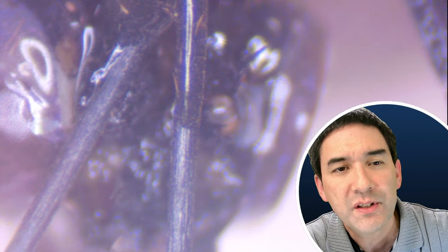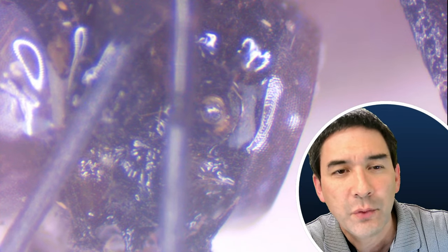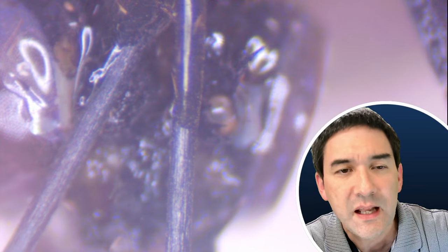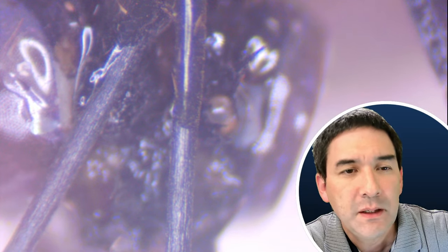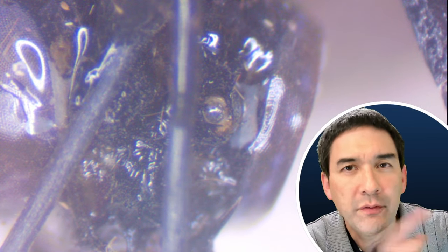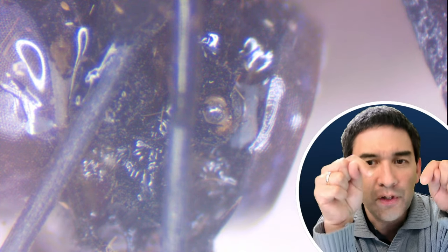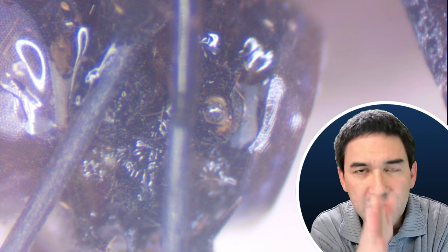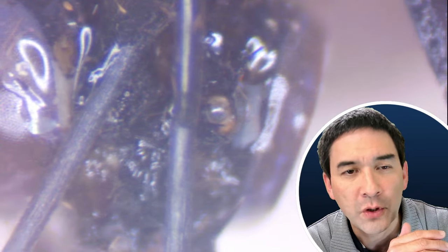Right now the antenna is in focus but the bottom part is not, and when I focus down the lower part comes into focus but not the antenna. When you do focus stacking, the computer combines the images to get everything in focus. When I focus up and down, you'll also see a horizontal shift — this is normal with stereo microscopy because the camera uses only one of the off-axis objectives. The focus stacking software will compensate for that.